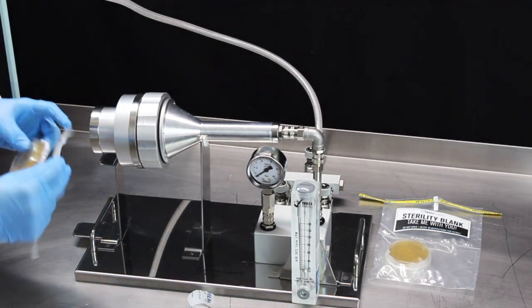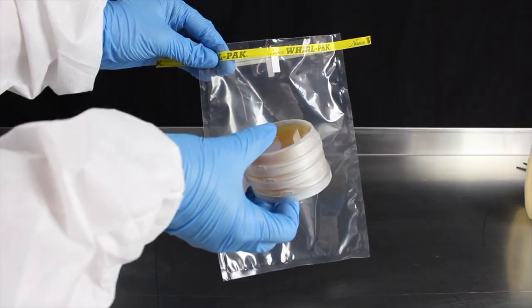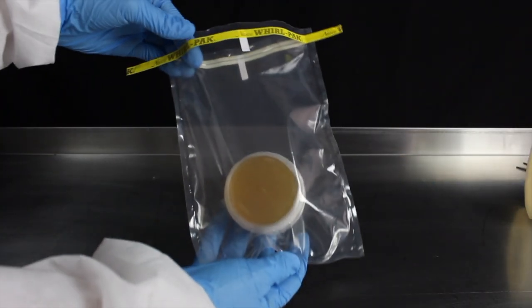This completes your sampling process. You are now ready to package and ship your equipment and samples to the laboratory.